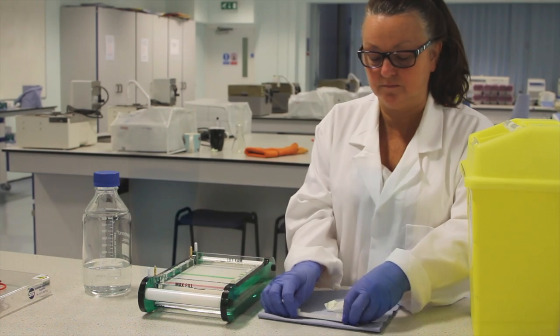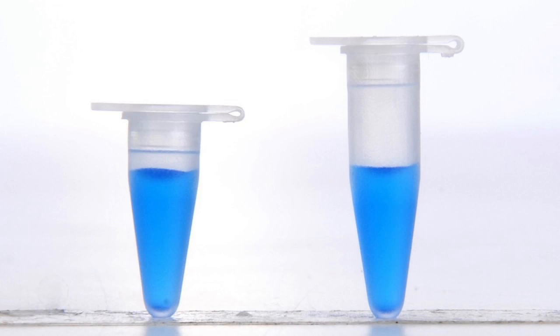Now the gel is ready to load. Your DNA samples should include a loading buffer which contains a dye to allow the progress of the gel to be tracked and a density reagent to help the sample settle into the well.